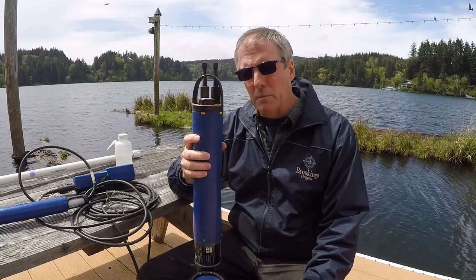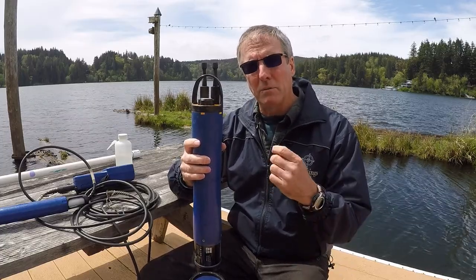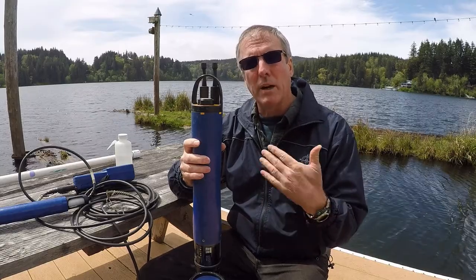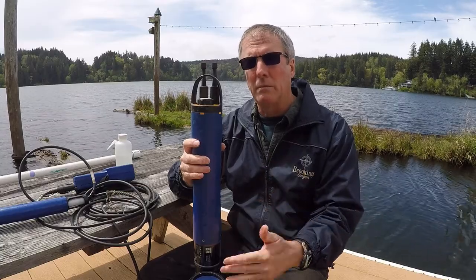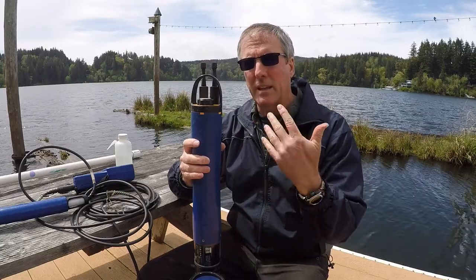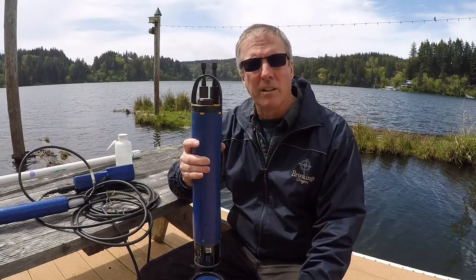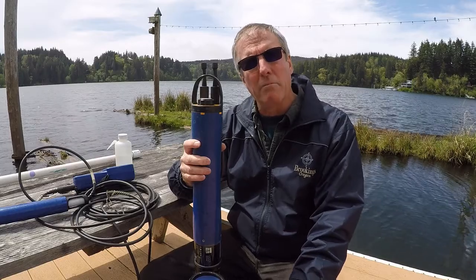It's a very similar idea to our continuous temperature probes, where we programmed it to take a reading every hour throughout the day. Once that continuous temperature probe was deployed into the stream, it continued to take that temperature reading every hour on the hour for as long as you leave it in the field, often 3, 4, 5 months at a time.